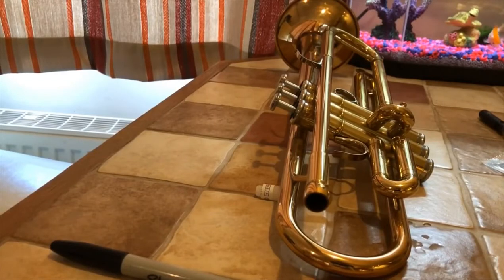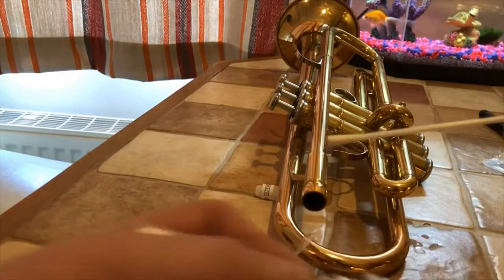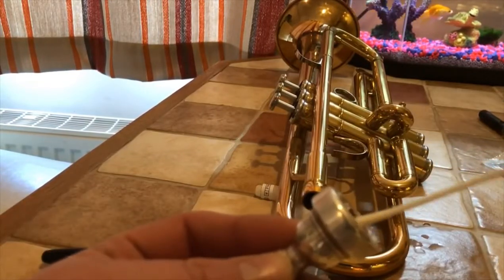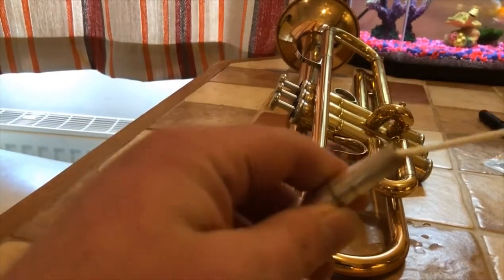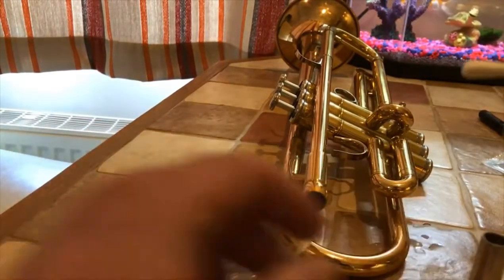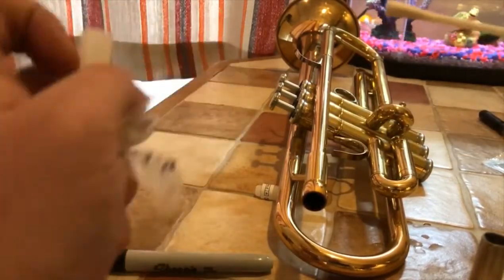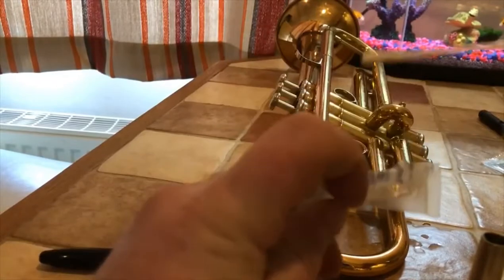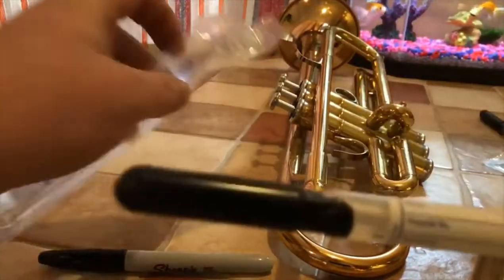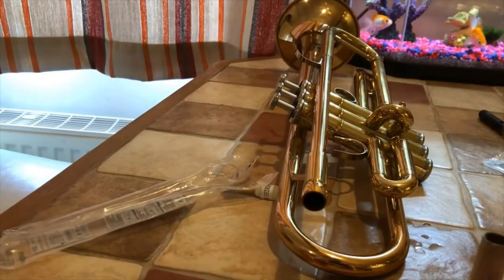I'll get you a close-up of this next one — we're going to do the mouthpiece. I'm going to take the swab out of the bag, pick up the mouthpiece, then get right in there, give it a good wipe around and get inside the back end as well. Give it a good wipe all over — you can see the discoloration on there. Then we get our tube and place our sample inside and lock it. Mouthpiece done.